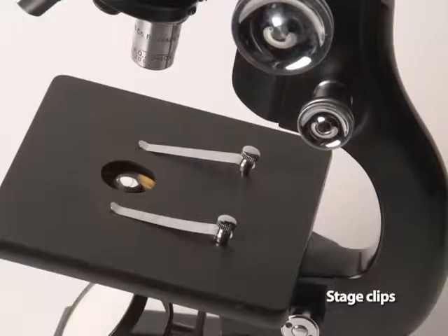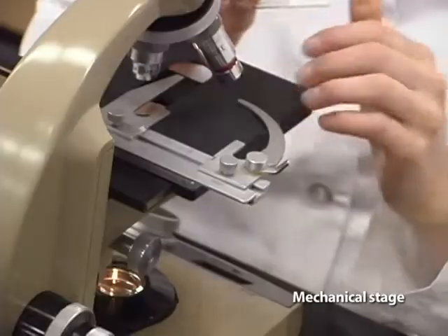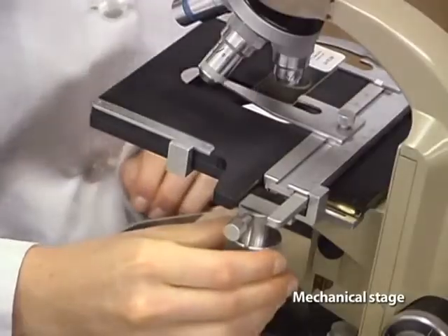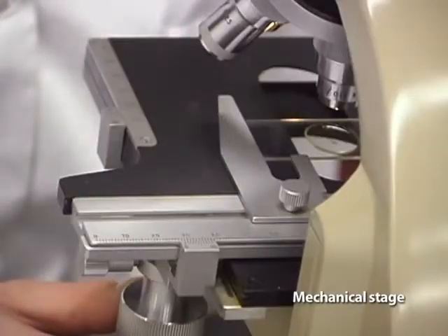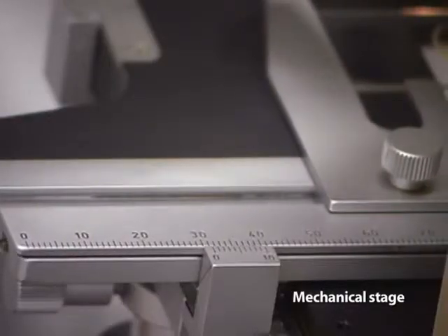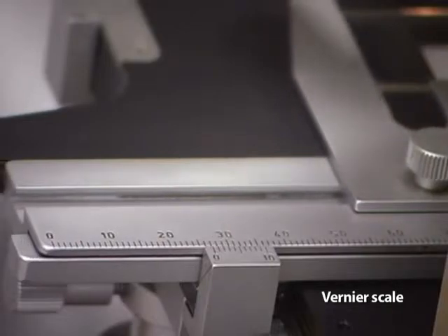Stage clips are often used on stereo or simple compound microscopes to hold a microscope slide on the stage and yet allow you to move it manually. In advanced compound microscopes, a mechanical stage is used to hold the microscope slide and move it from side to side and back to front. With the numbers on the side and back of the mechanical stage, you can repeatedly find the exact position of an object on a slide. A vernier scale allows references to 1/10 of a millimeter.